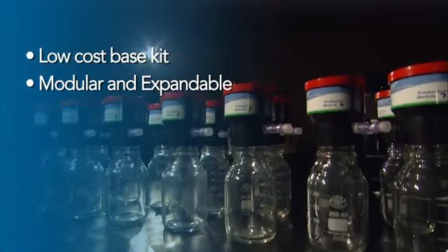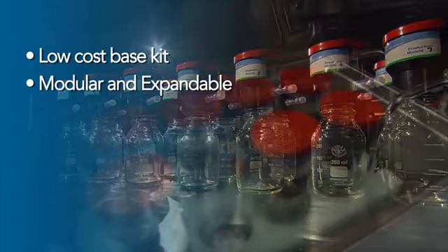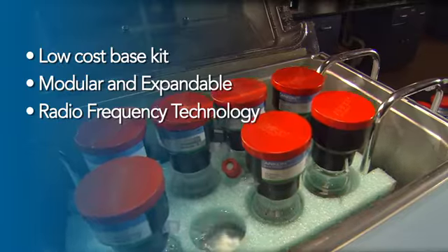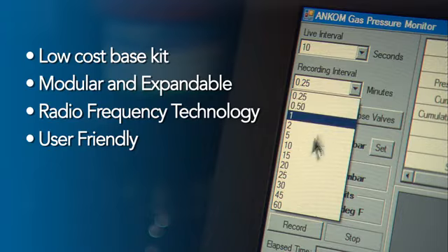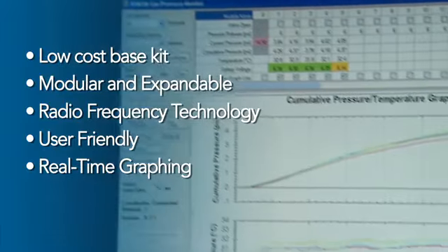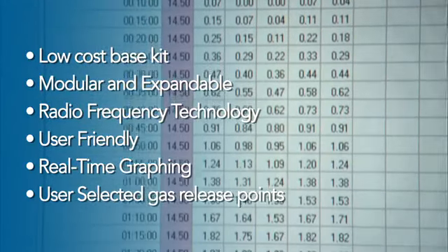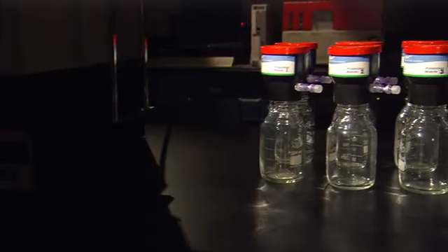This allows the user flexibility in study design and the capability to test a number of variables during a single test. It uses wireless technology that allows modules to be placed anywhere within the radio frequency range, freeing up valuable counter space for other uses. It includes user-friendly computer software that makes it simple to use the system and analyze the results. It provides real-time graphing of pressure and temperature curves to aid in monitoring kinetics at any point in time. It allows user-selected gas release points to control the amount of pressure that builds up within an RF1 module. A modular design at a low cost that is easy to configure and use.